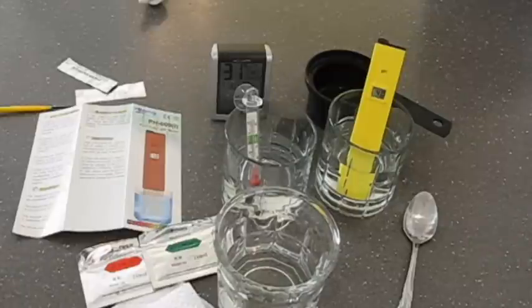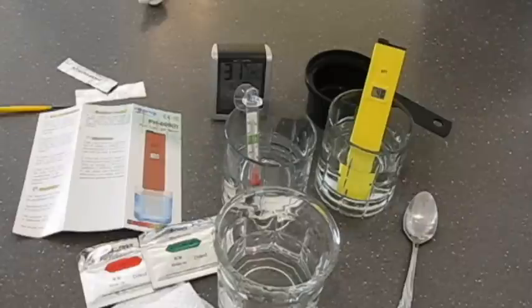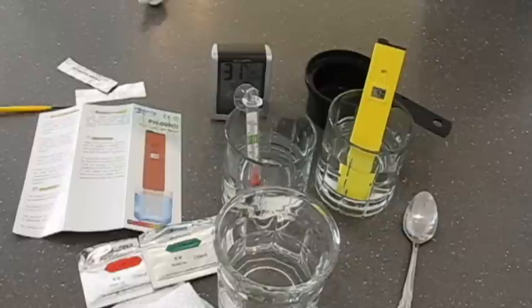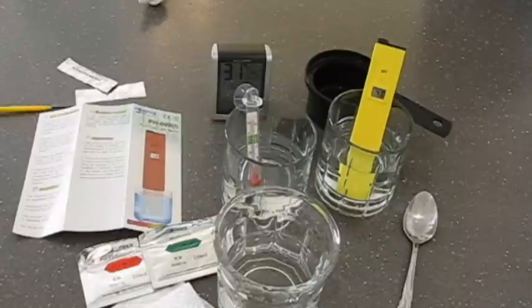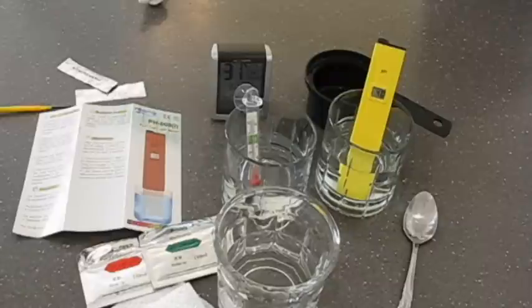And I've also read that the pH probe should be kept moist after I've used it here. I'm supposed to keep it in probably regular tap water is fine, but I read one place said to put it in pH level 3 liquid for best results. But you should keep it moist after you've opened it and used it.